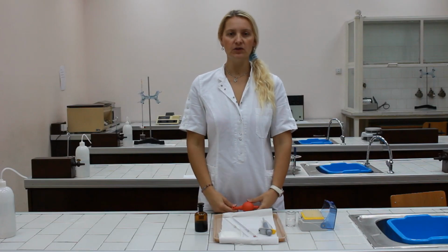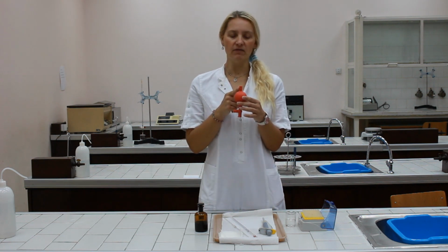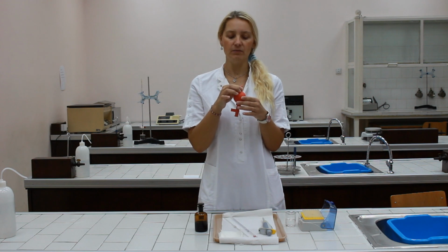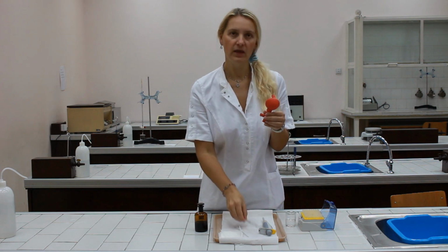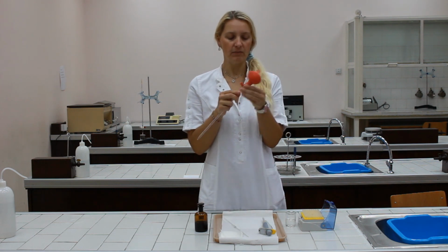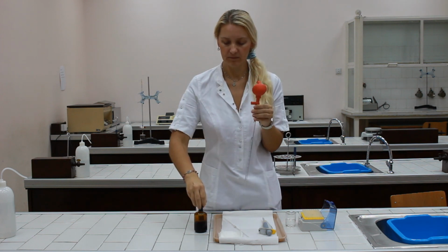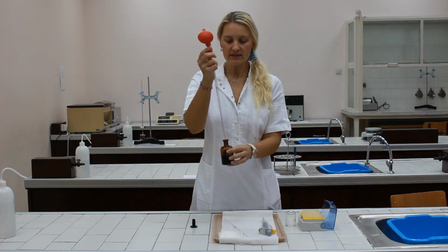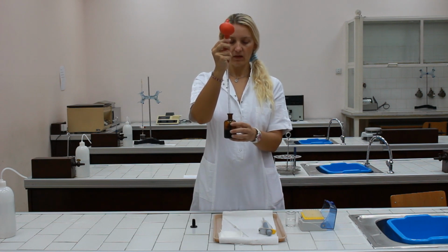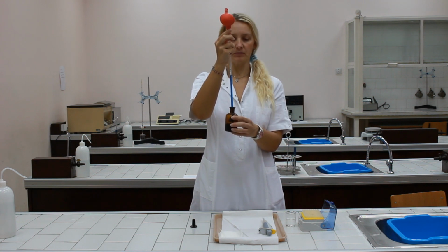I'm going to explain to you the correct procedure of using the glass pipette and bulb pipette filler. First, by using valve A and squeezing the bulb, empty the bulb or evacuate the air from it. Now, insert the pipette in the pipette filler. To pick up a sample, press valve S and the liquid will draw up above the graduation mark.